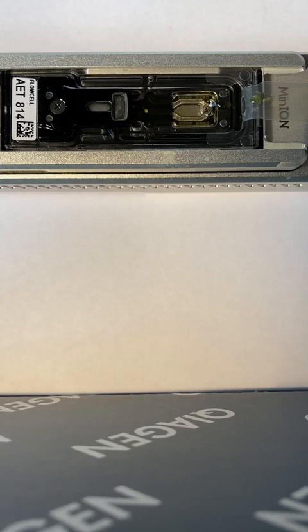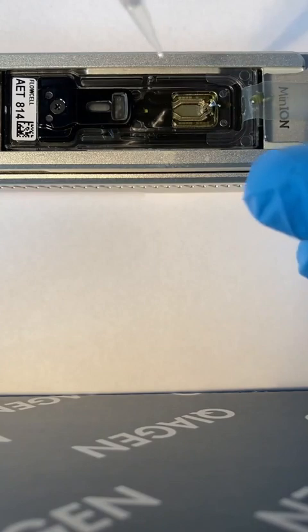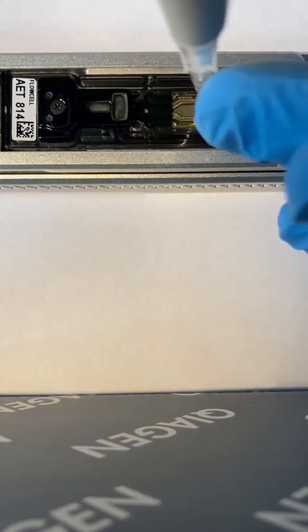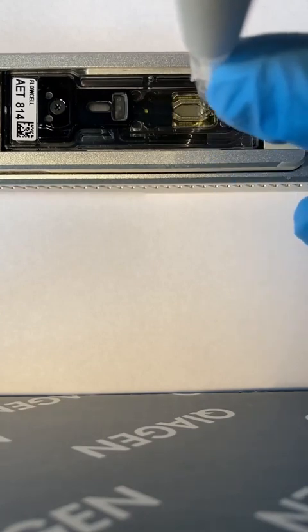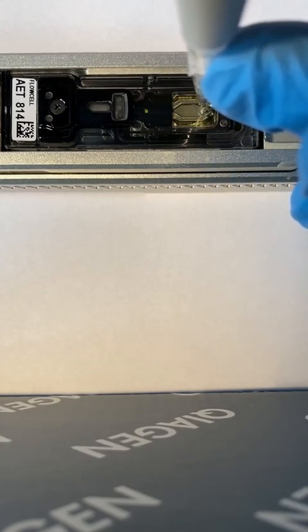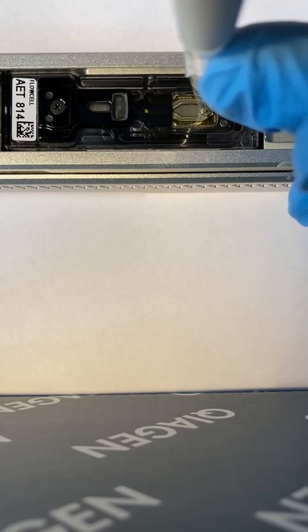So what's happening now, you don't see me. I'm putting a new pipette tip on the pipetter, and I'm pulling up 30 microliters of the library, which is, by the way, a mixture of tube 2 and tube 3. So when you mix the 10 microliters from tube 2 into tube 3, which had 65 microliters of a resuspension buffer, you have 75 microliters. For a Flongle, you only need 30 of that.